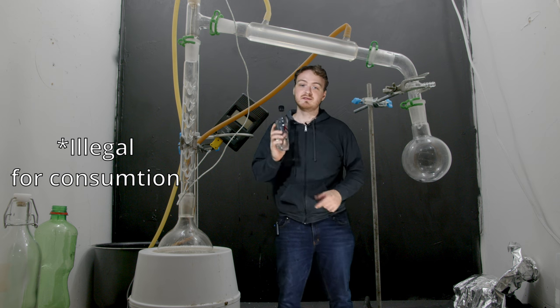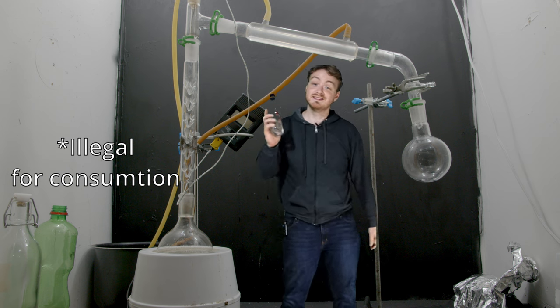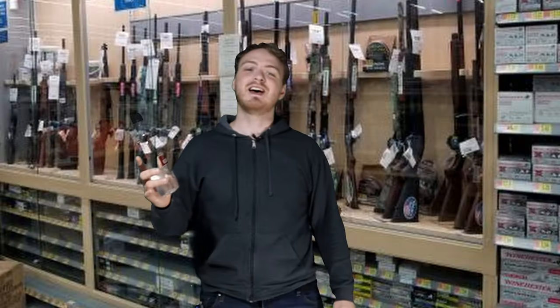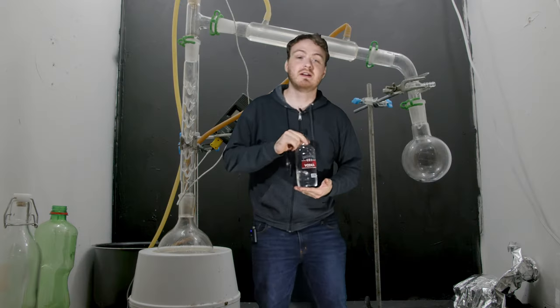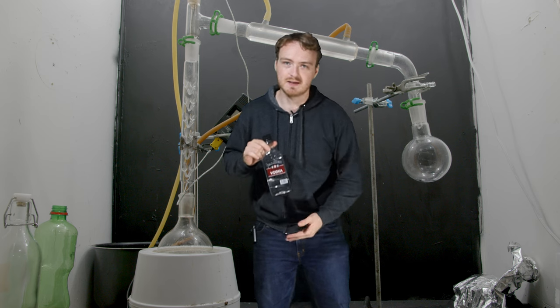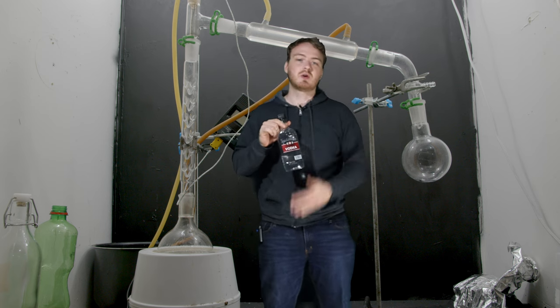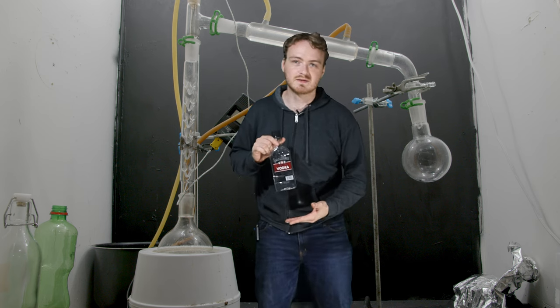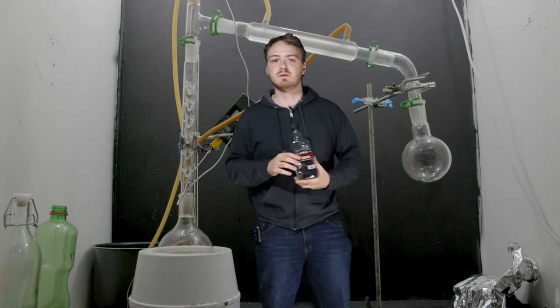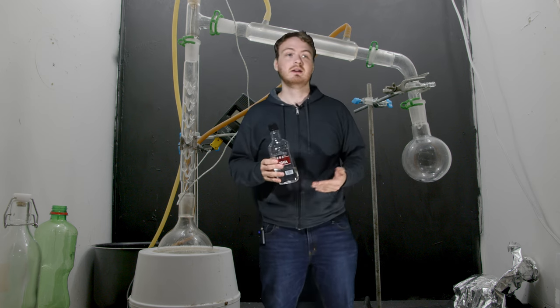Important thing to note here, distilling alcohol in the United States is illegal without a permit. Yes, in the country where you can buy a crossbow at Walmart you are not able to distill alcohol in your own home. So what we're doing today is not for consumption. It is for lab purposes, nor should you even be considering doing this for consumption because all of the equipment that we use is dirty and not food grade.